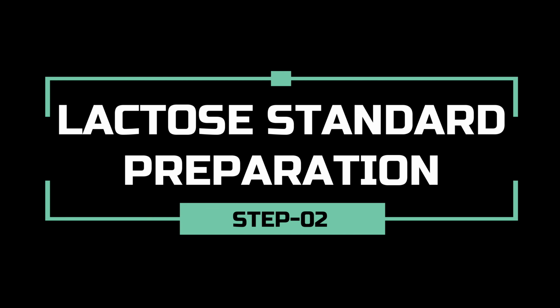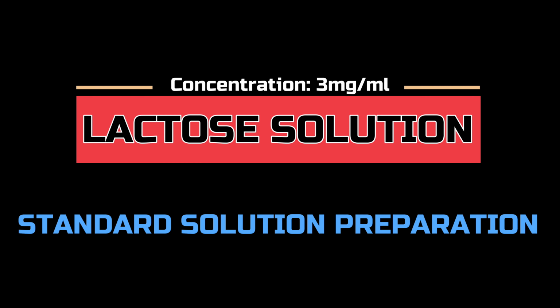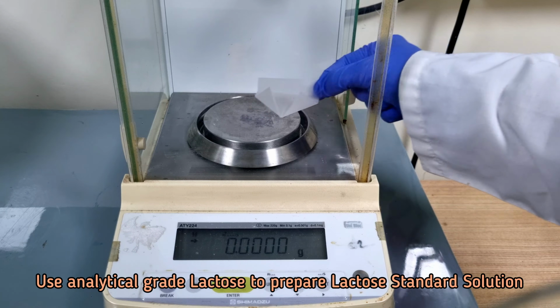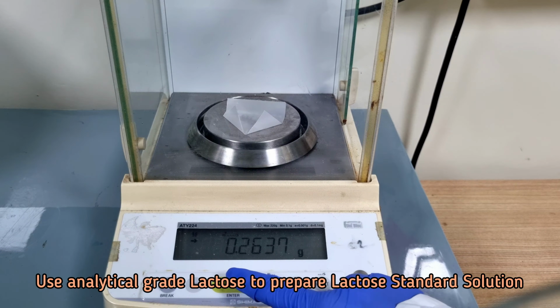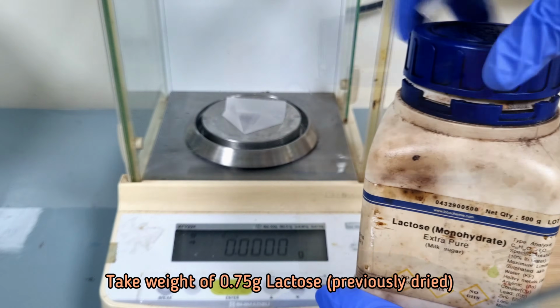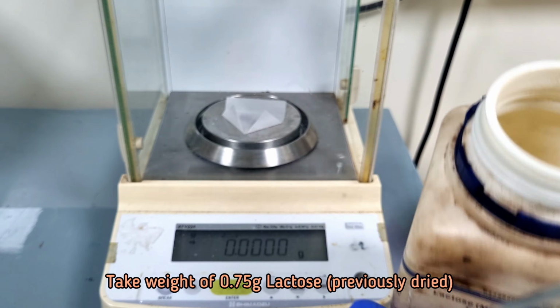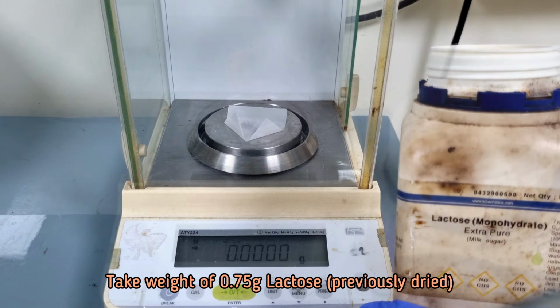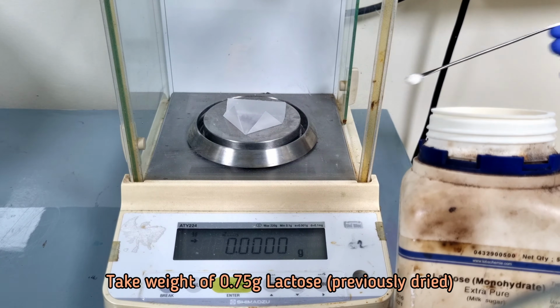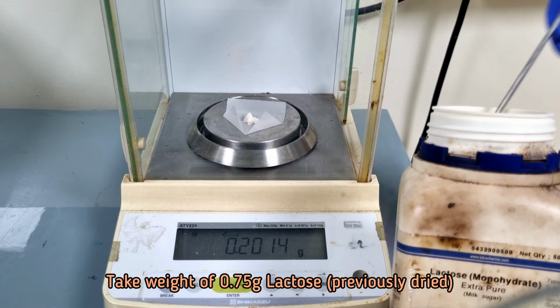In this step, we will prepare lactose standard solution at a concentration of 3 mg per ml. Take weight of 0.75 gram previously dried lactose.